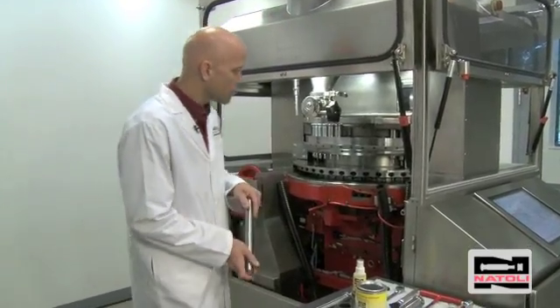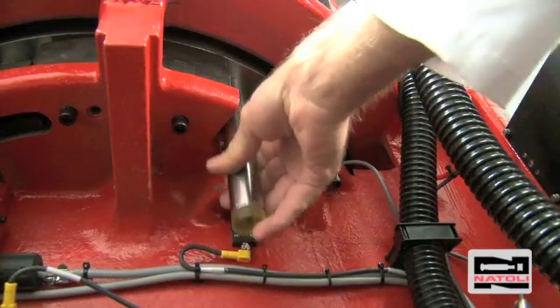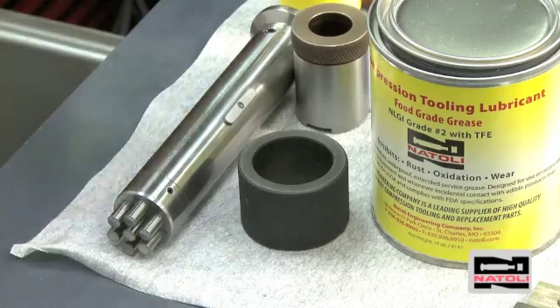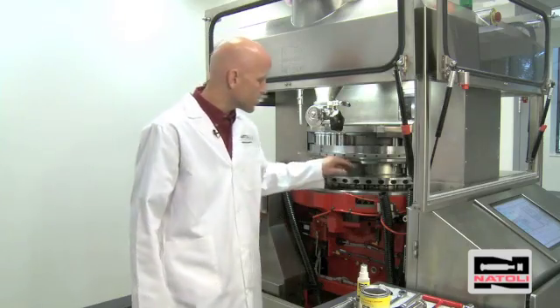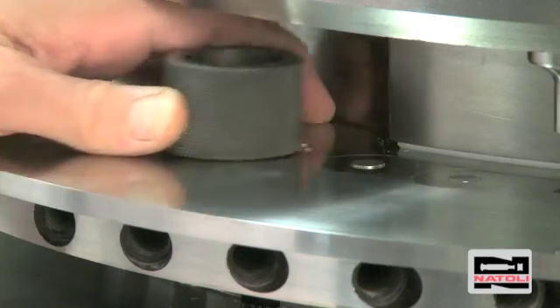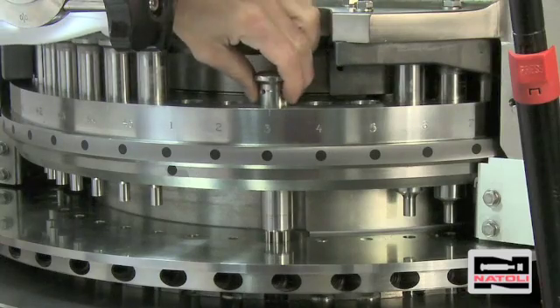Take the die driving rod, insert it into the lower punch guide, and tap up on the bottom of the die to make sure that the die lock screw is holding the die down properly. After tapping on the bottom of the die, take your die insertion ring again and rub it across the top of the die table to verify that the die did not come out. Next, recheck alignment with the upper punch.